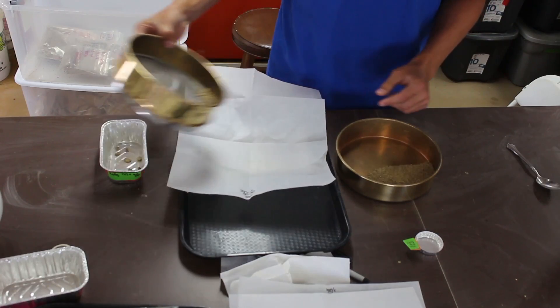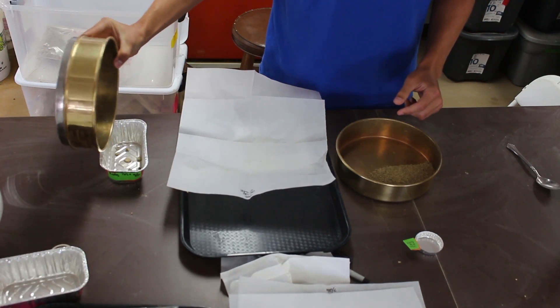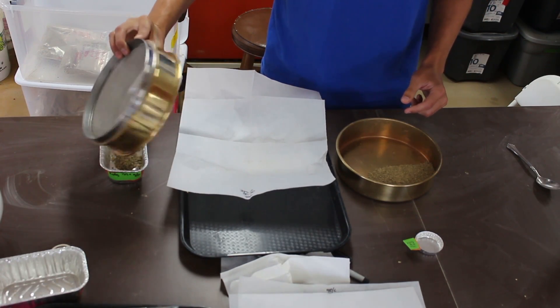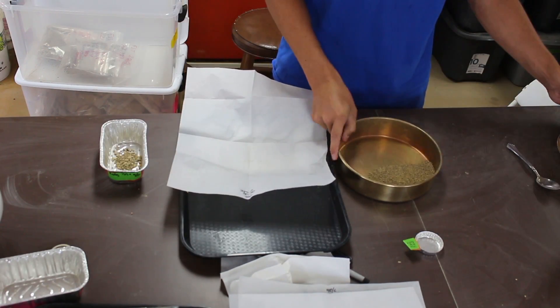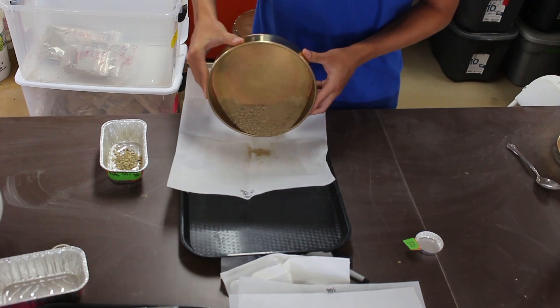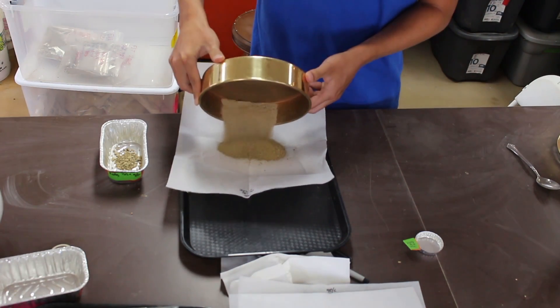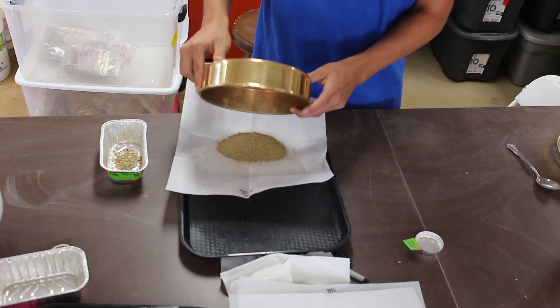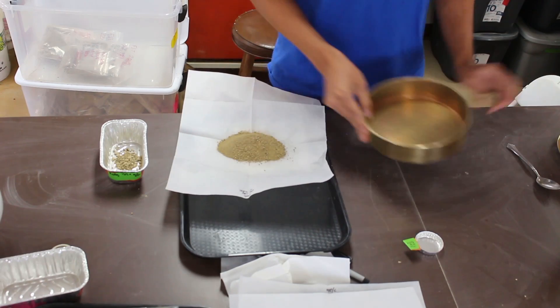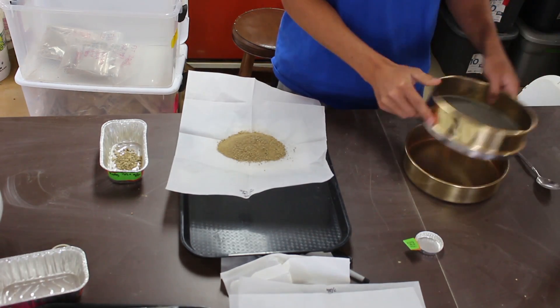Scott then places the soil onto a paper and tray to dry for the next five days, and places the rocks into a tin. This dried soil will later be sent off for analysis to look at various minerals and percent carbon and nitrogen.